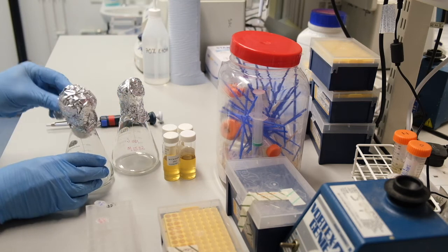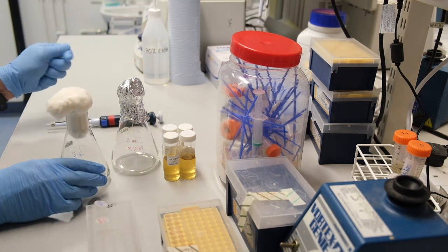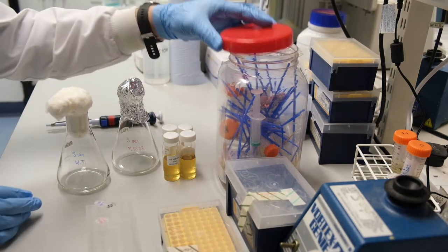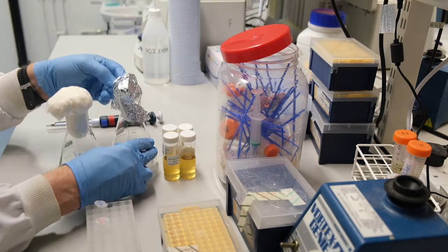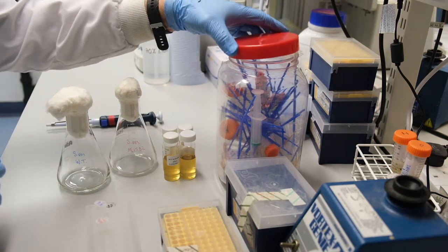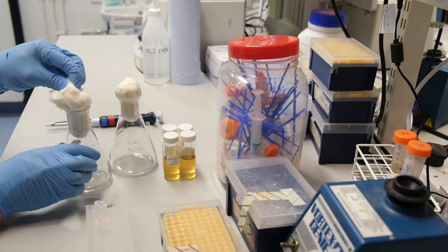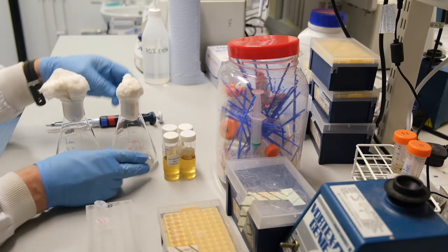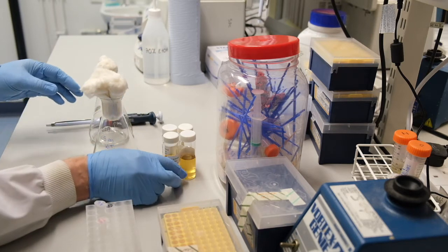In the remaining part of this video, we will inoculate two shake flasks with MYM liquid media with Streptomyces venezuelae spores. Here we are preparing one culture of wild type Streptomyces venezuelae and one culture of strain M1582 Streptomyces venezuelae.